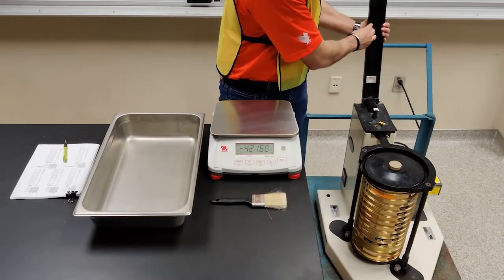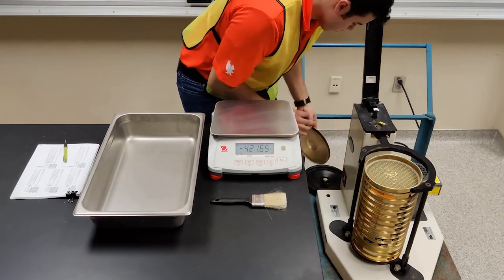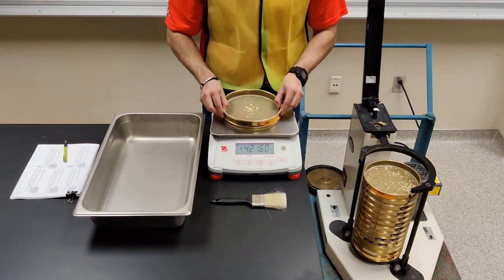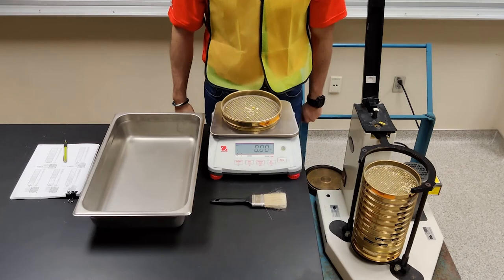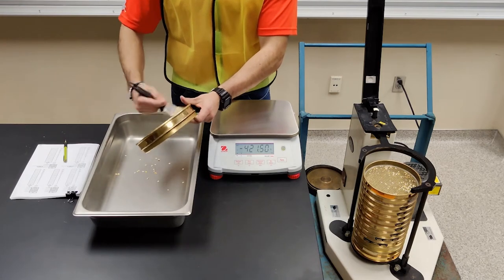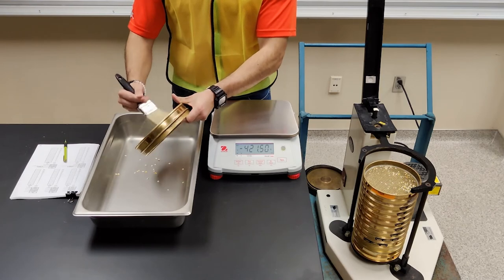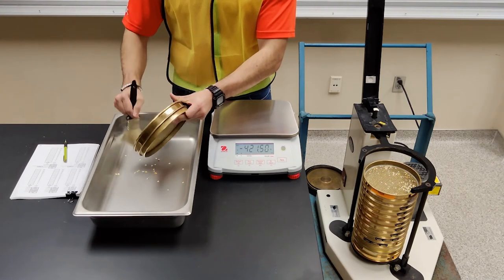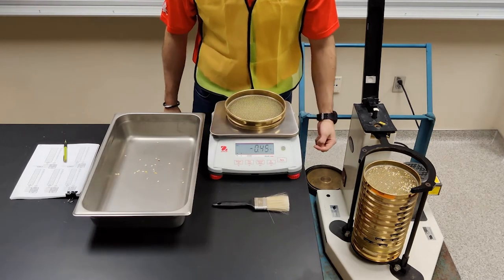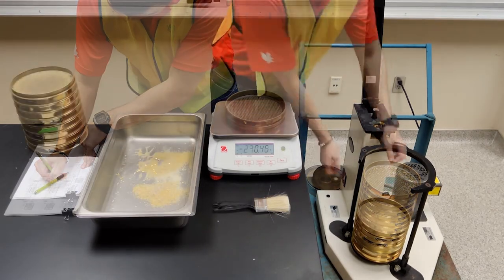Once the Ro-Tap has stopped, remove the sieve stack from the shaker and proceed to weigh the amount of material in each sieve. Place the sieve with the retained material on the scale, tare the scale to zero, and then thoroughly clean the sieve with a brush or using a vacuum. Do not wash the sieves as it will make the wire mesh rusty, narrowing the opening, making the results inaccurate and leading to an overestimation of the particle analysis. Weigh back the empty sieve and record the weight. The weight should be negative, which corresponds to the weight of the material in a particular sieve. Repeat the procedures for each of the sieves.